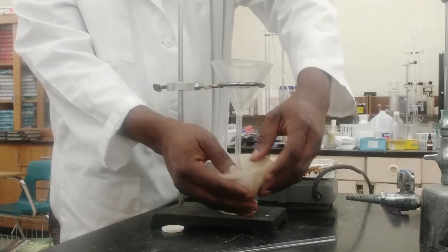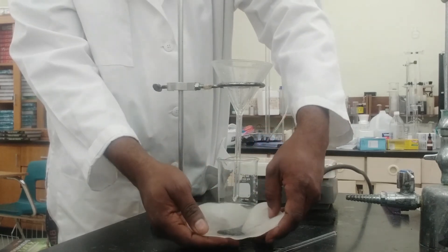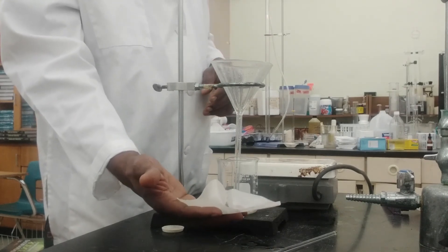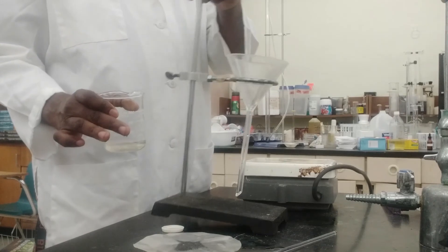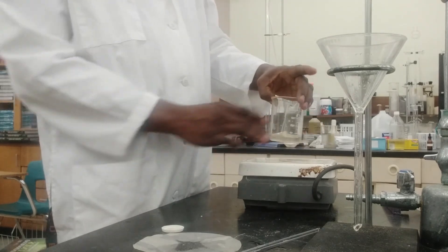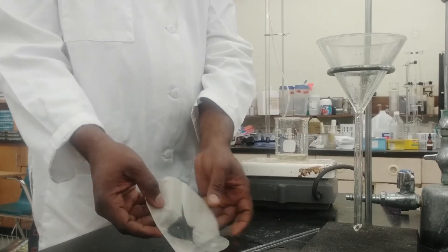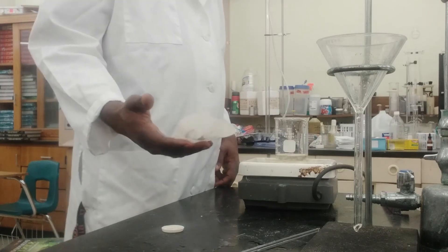If you look there, we have our sand — I'm going to open the filter paper gently. There you go, we have the sand. What I'm going to do is place it in an oven and allow it to dry. For our filtrate, I'm going to place that on the hot plate. My beaker is made out of Pyrex, so I can actually heat it up. We're going to leave it there to boil off the water and the salt will crystallize, while I place the sand in the oven to dry.